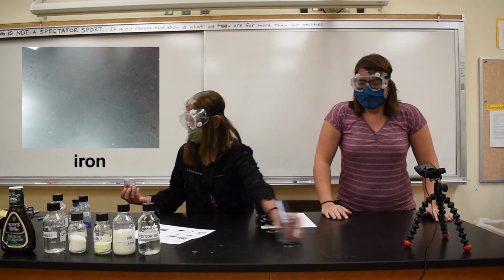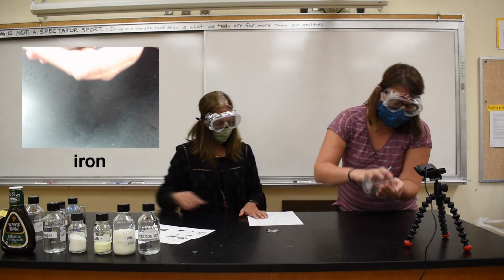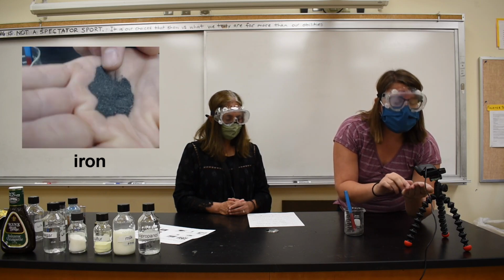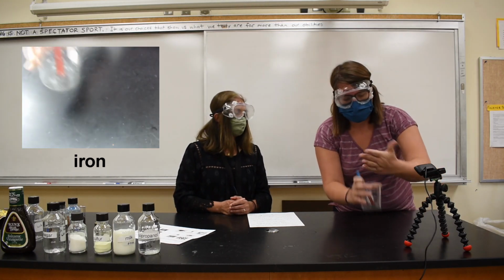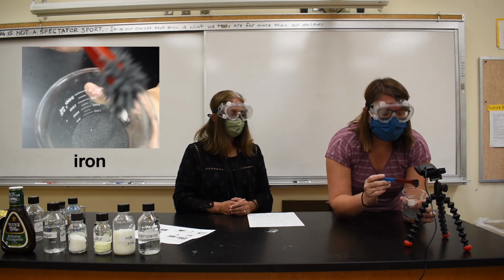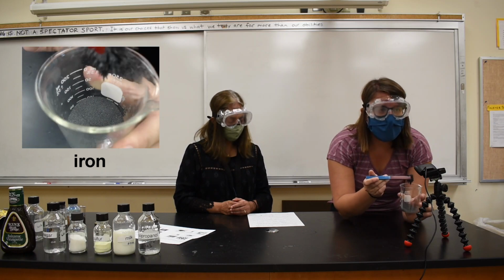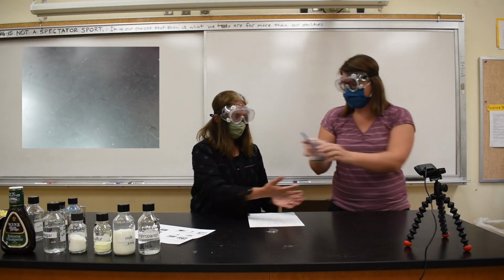Next is iron. I'm going to put a little bit out on my hand here so you can see it. So it's in a fine powder. Maybe there's some pieces that are a little bit shiny, the rest of it's dull gray colored. There's an interesting thing about this one. Miss Sullivan has a magnet there. And see how it sticks to the magnet. It almost makes little spikes off of the magnet. So iron responds to magnetism. Something that we haven't seen in any of our other substances.